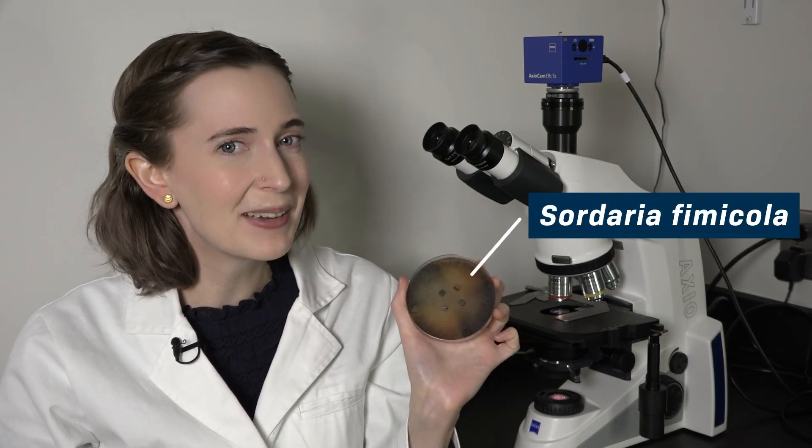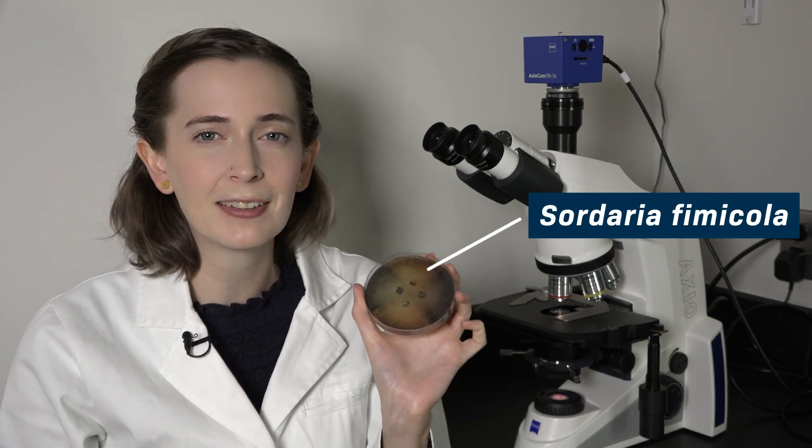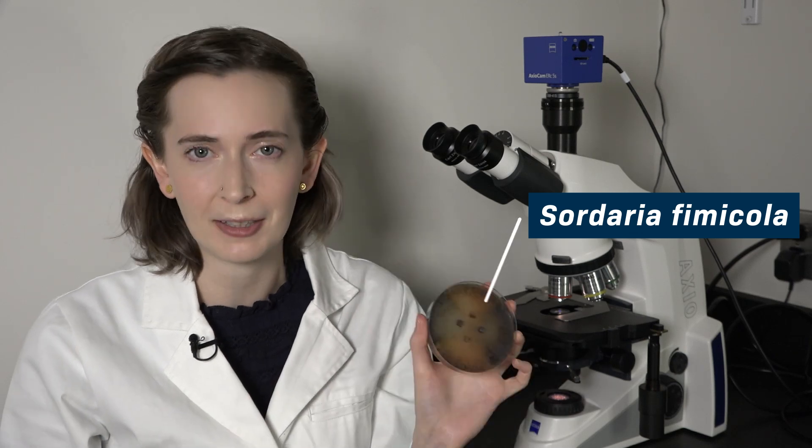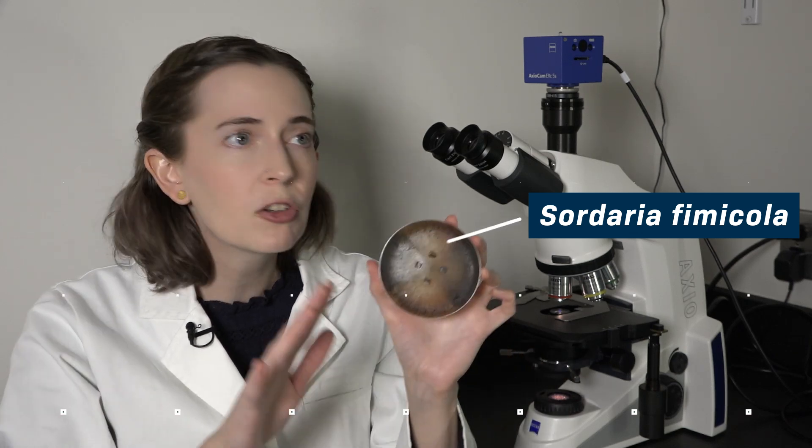That's right, we are going to use a fungus called Sordaria fimicola for our experiment because its life cycle is great for visualizing meiotic recombination. Picture this.